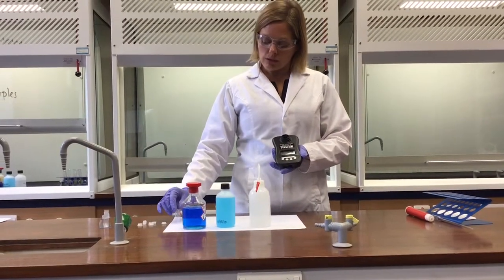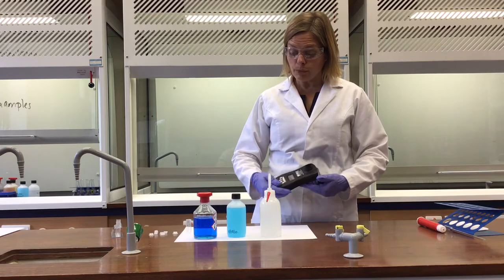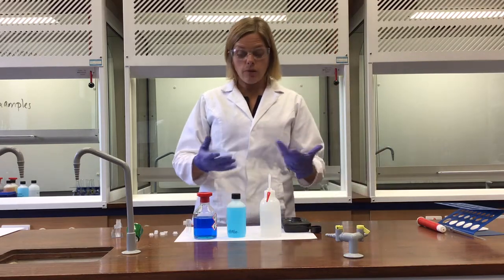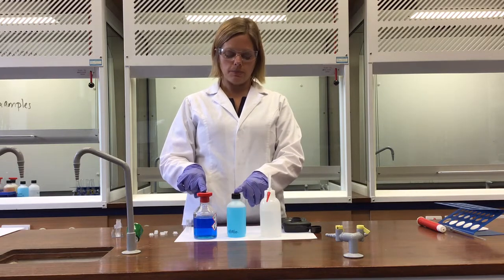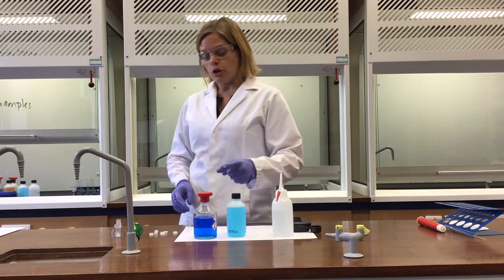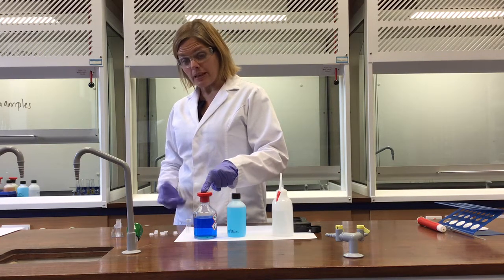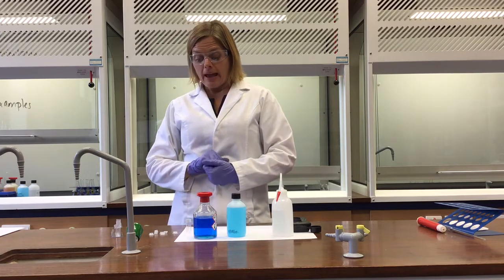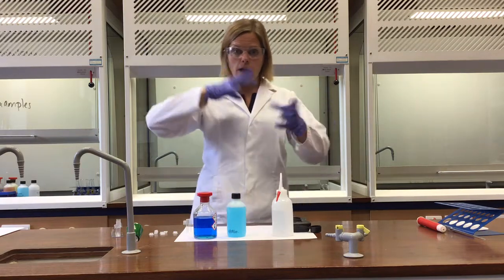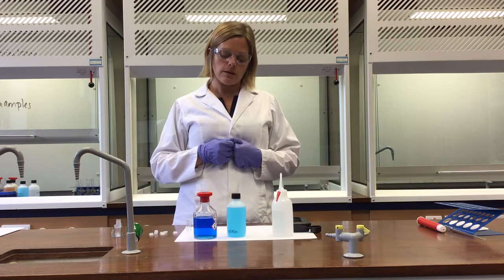So in order to do that, this is another example of calibration, really. It's important to know what that absorbance reading is for 0 moles per decimetre cubed of the copper(II) ion, so in other words, just using some distilled water. It's important to know what the reading is for 1 mole per decimetre cubed copper(II) sulfate solution. And indeed, it's important to measure some of the values in between the two to check that it's a straight line, or indeed to produce a line of best fit if necessary.